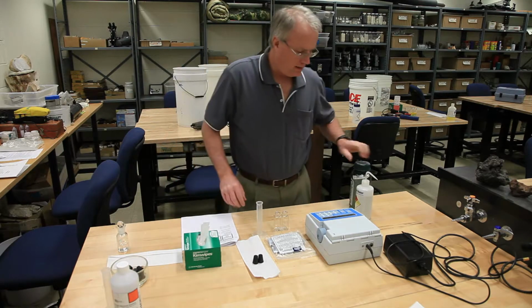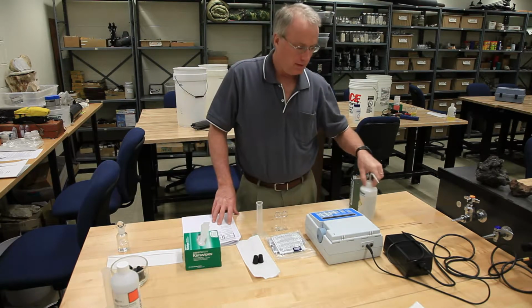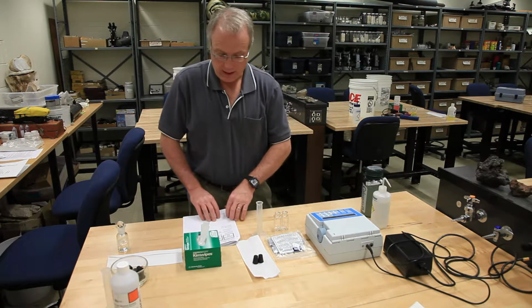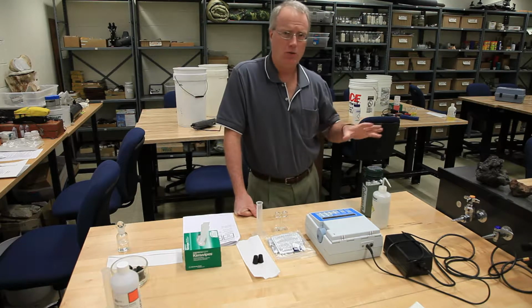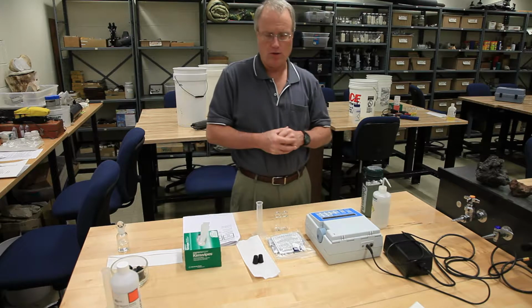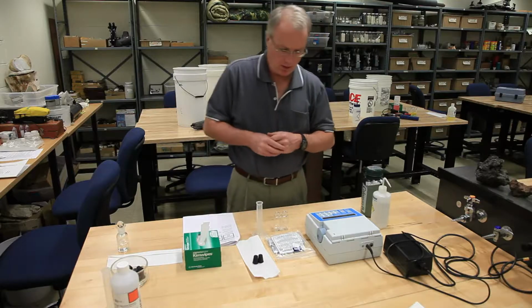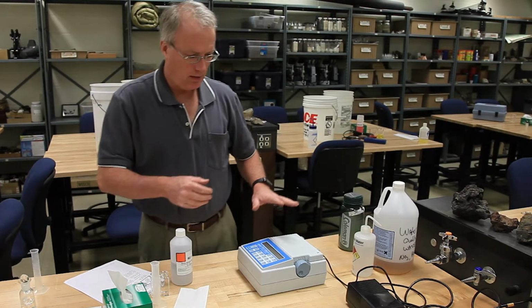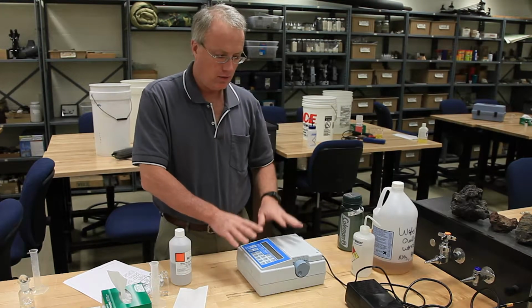Okay, the next test that we're going to talk about is for nitrate, and it runs very similar to the phosphate test. So please, if you're going to do the nitrate test, please also watch the video for the phosphate. You want to see both of these videos because there are some minor differences that you want to really be aware of.